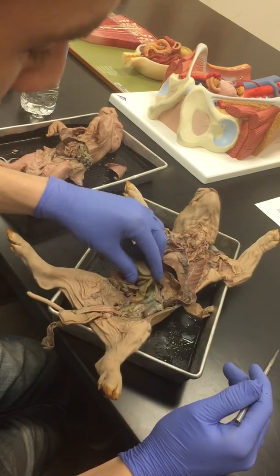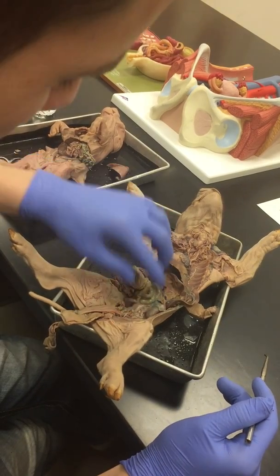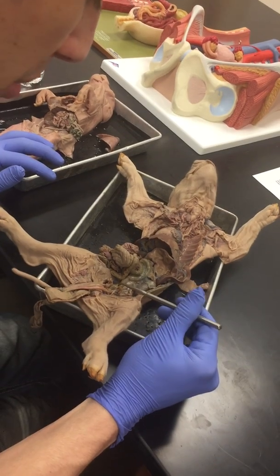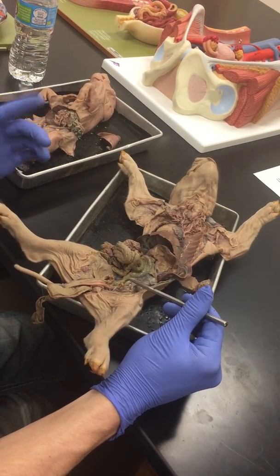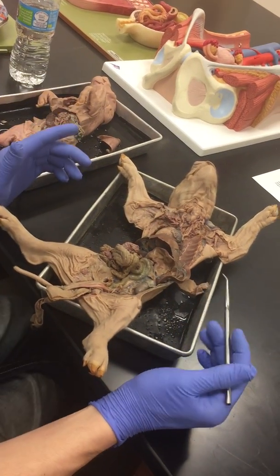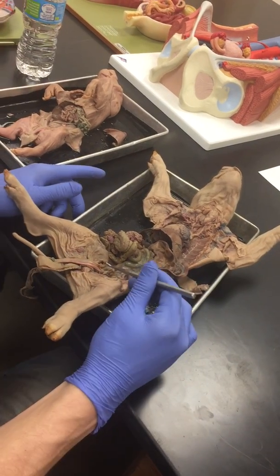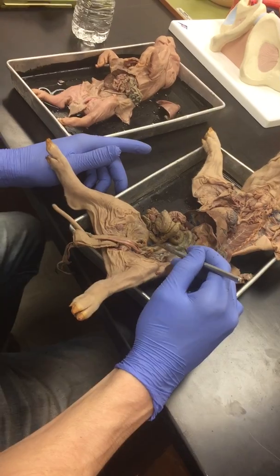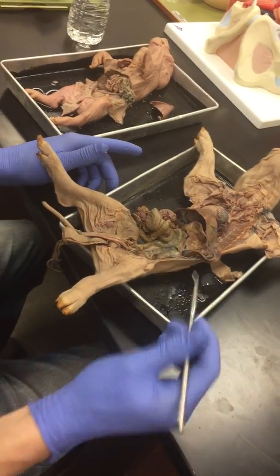So the large intestine, they've got a spiral large intestine. We can ask for that. And the large intestine will continue down. If they ask for this tube here, that's still part of the colon. You can use colon and large intestine interchangeably. I'll count either one of those. So don't be confused. This entire tube is the last part of the large intestine right here.